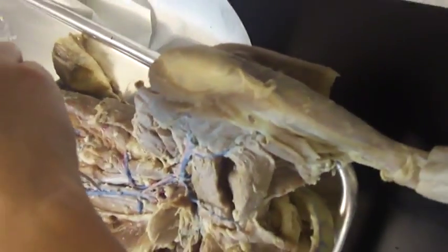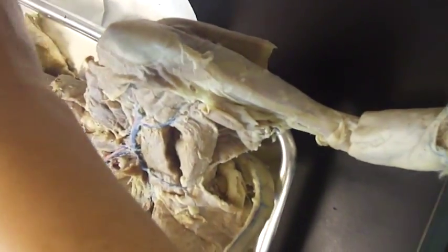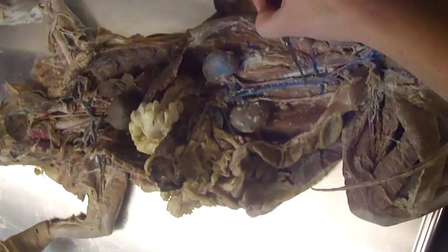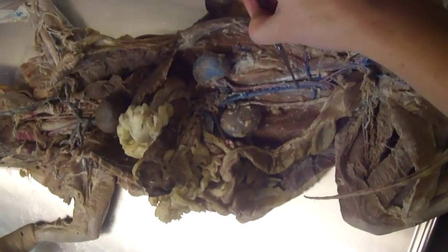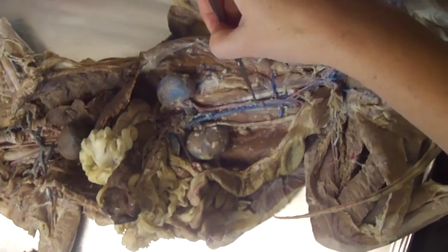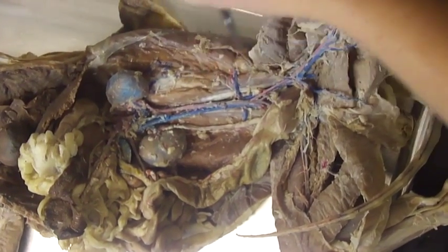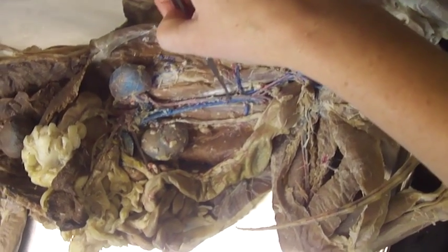Continuing down the descending abdominal aorta, we have our inferior mesenteric here — all that remains is a little stub — but it's also unpaired, and it's also going to the mesentery in the intestines, just more in the inferior region of the body.